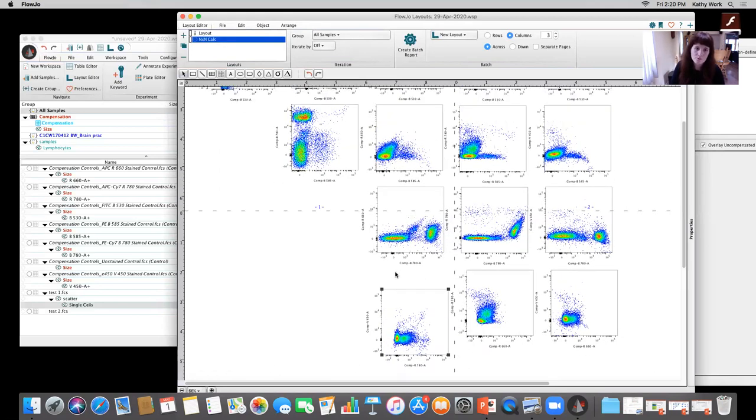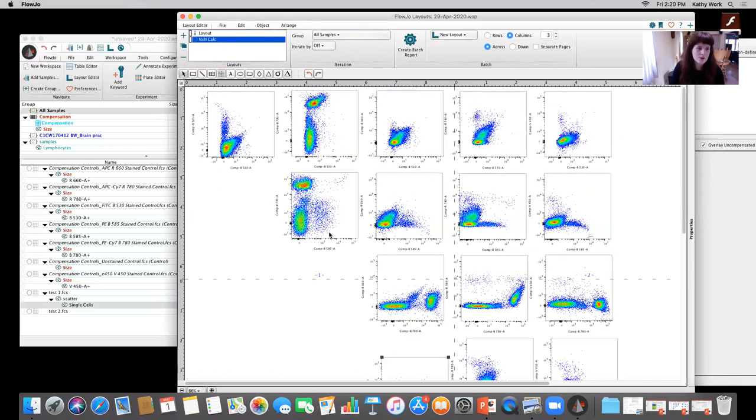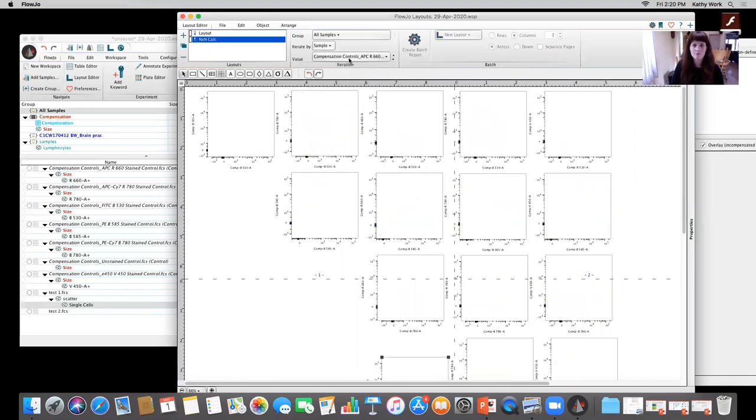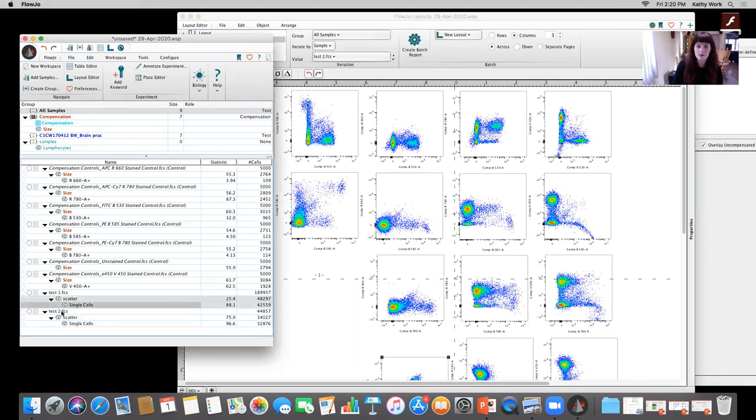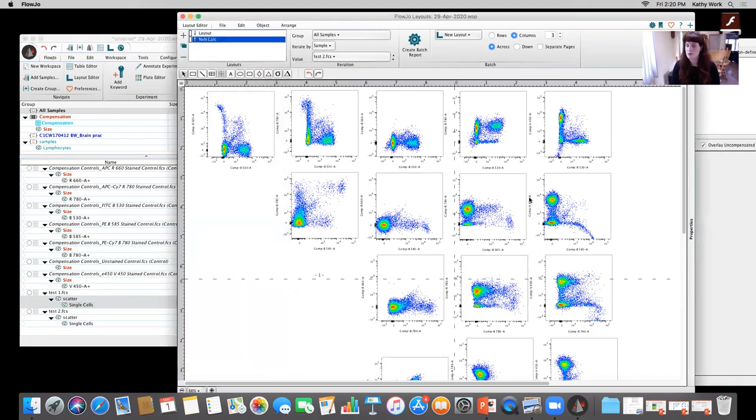Okay. So, I'm gonna iterate by sample. I'm gonna take a look at this test. It's not working because I need to drag this over. It's not gonna show me anything if I don't have those gates selected, right? So that's a good example. If I don't have the scatter and single cell, it's not gonna be able to show me those populations in this N by N. And one of the things that I see here is this overcompensation.